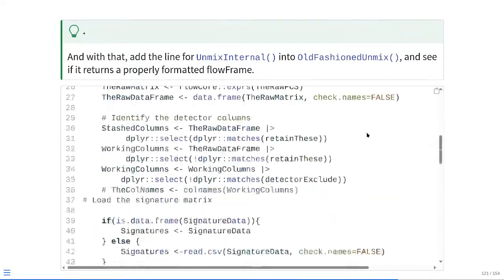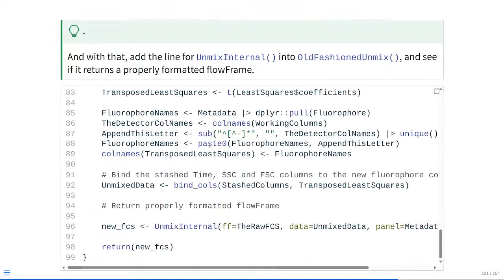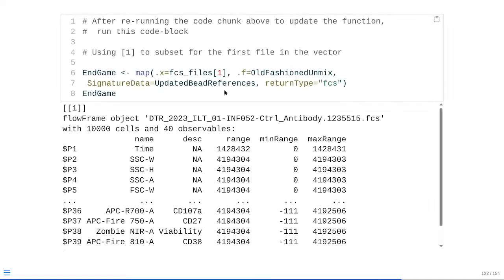At that point, if we scroll all the way down here, you can see we left off with the unmixed data with both time, forward scatter, and the fluorophore columns. We passed that unmixed data along with the original flow frame and the panel data information to unmixed internal. It returns to us that properly formatted flow frame, which is stored under new_FCS, and then new_FCS is what's being returned to our local environment. And if we go ahead and run this, this is what we end up with.